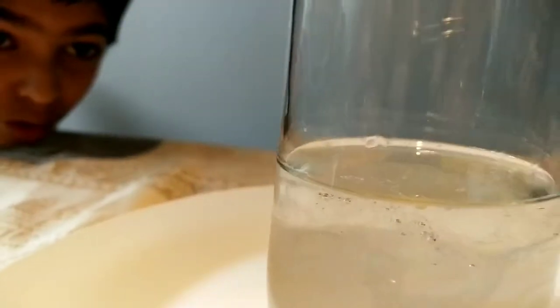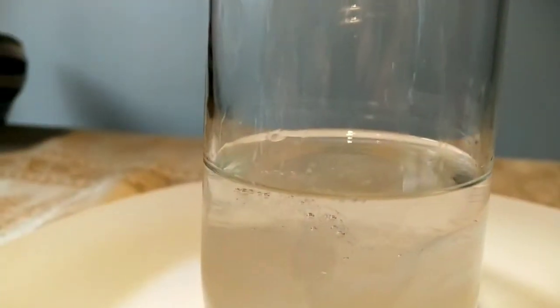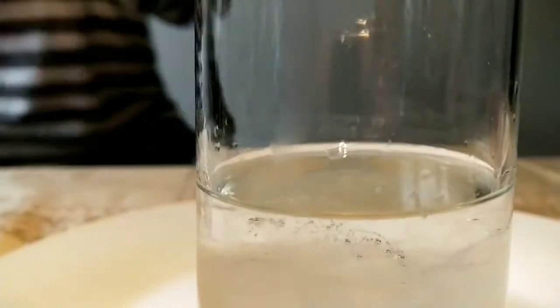Can you see that? There are small bubble-rock things connected to each other — that's clumps of DNA! Can you see these little strands which are attached to small bubbles? That is so cool. There are so many. Wait for a while and you can get more of these.